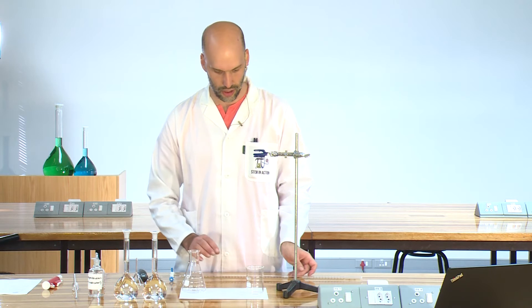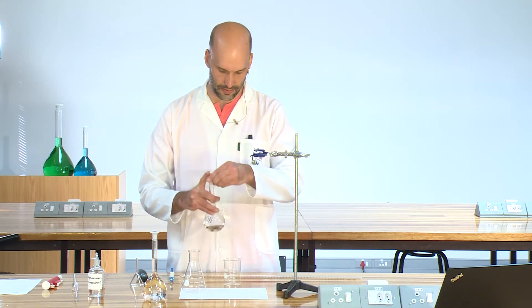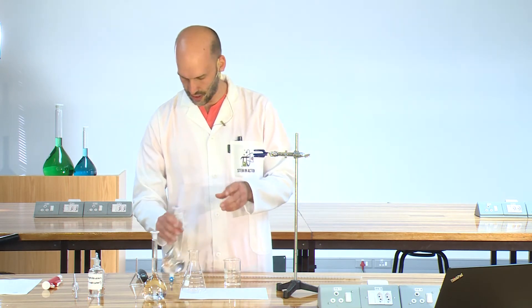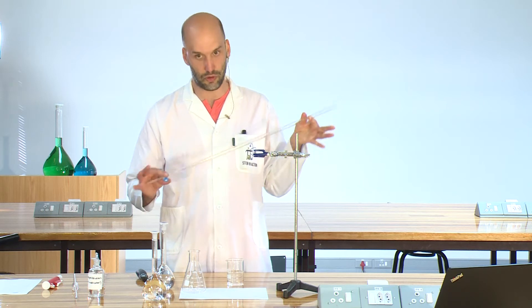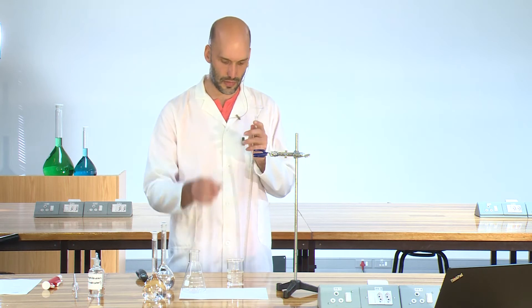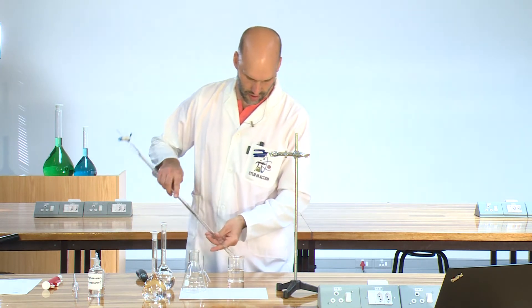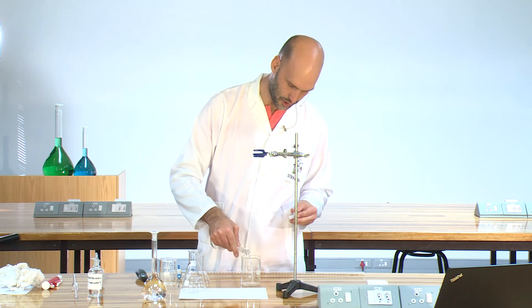It is very important to note that the standard solution goes into the buret, and our unknown solution goes into the conical flask. So what we are going to do is fill the buret. I will get my standard solution and use my glass beaker. I am going to pour a little out. I am going to use my funnel. First, what I want to do is rinse the buret - I will put my funnel in and pour about 4 or 5 milliliters in.